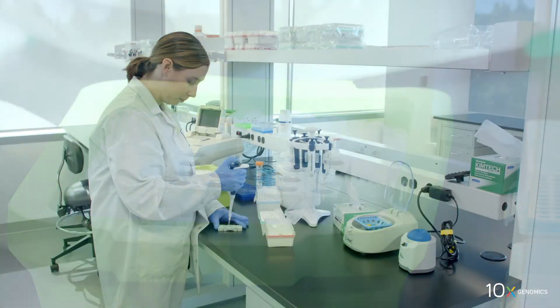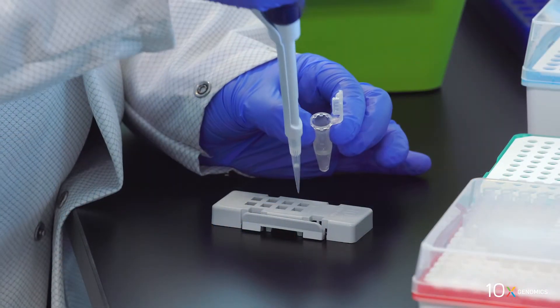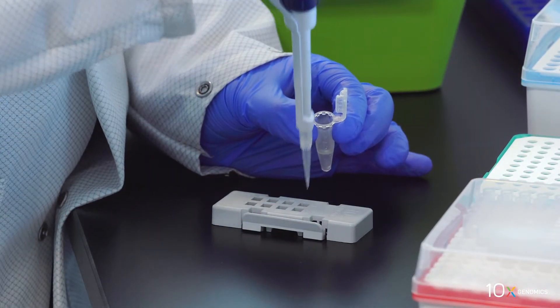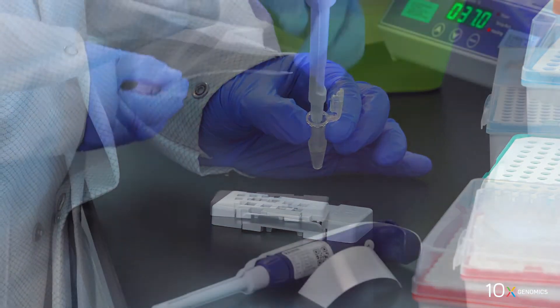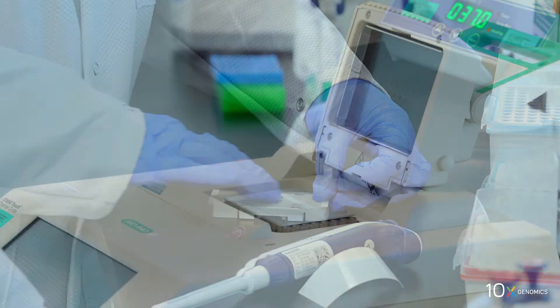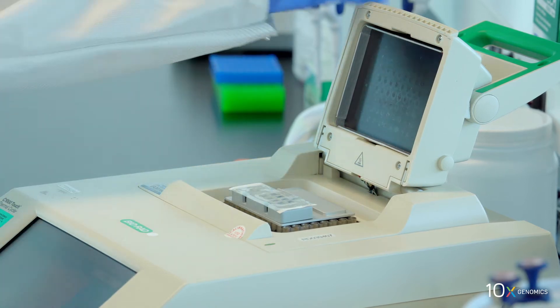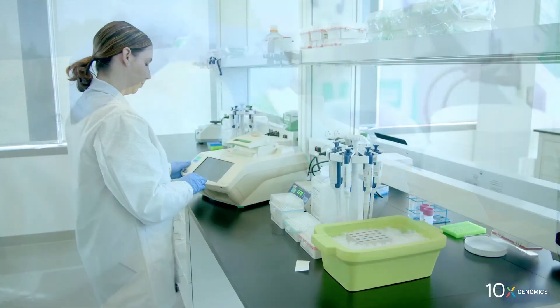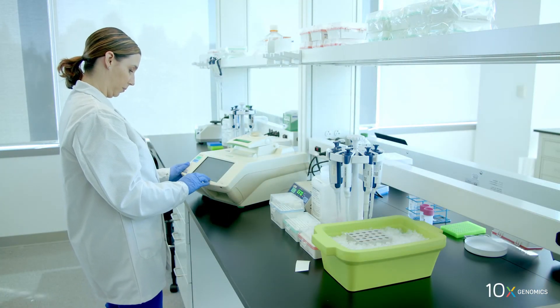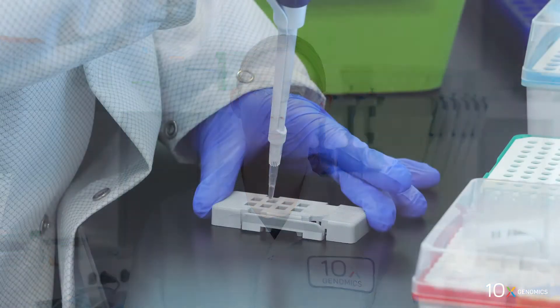Remove buffer EB from the wells. Add 75 microliters second strand mix to each well. Apply slide seal on the slide cassette and place on the thermal cycler adapter on the preheated thermal cycler. Skip the pre-equilibrate step to initiate second strand synthesis.